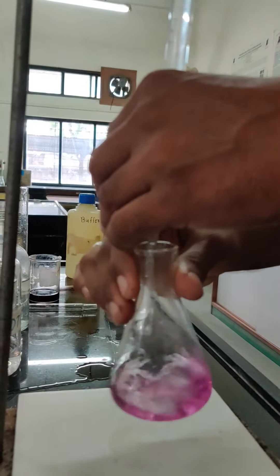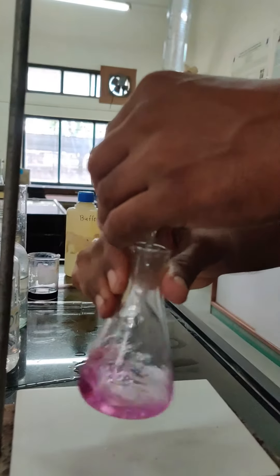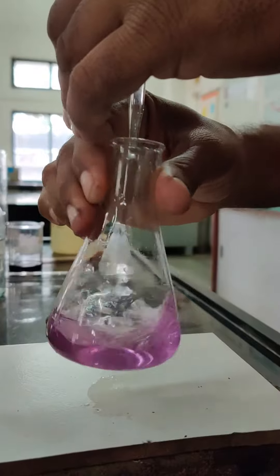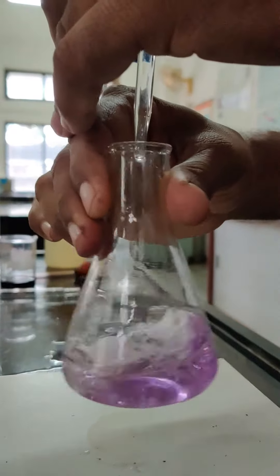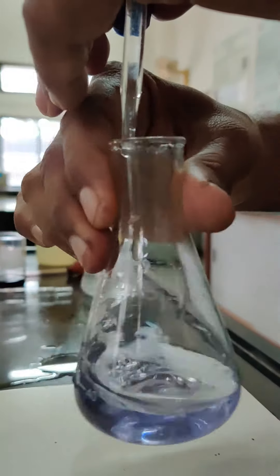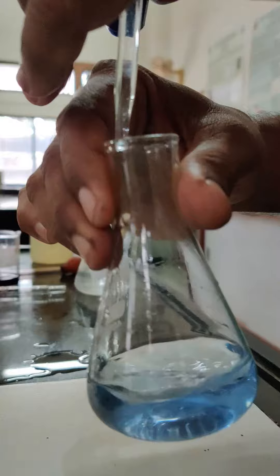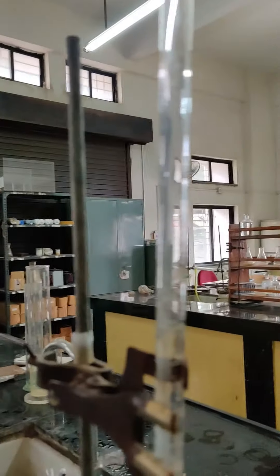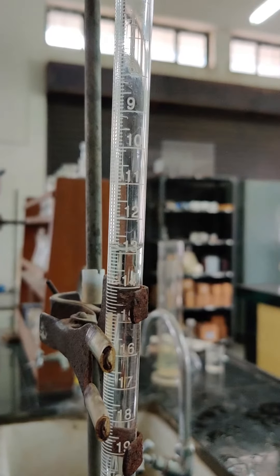We keep on stirring until we get the blue colour. Now the end point has been reached — you can see there is a colour change from pink to blue. We note down the reading from the burette, which has come to 12.8 ml. We note this reading and proceed to the further calculation.